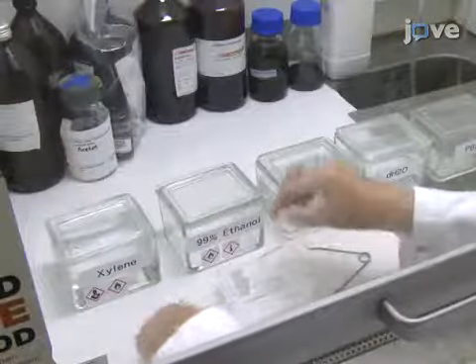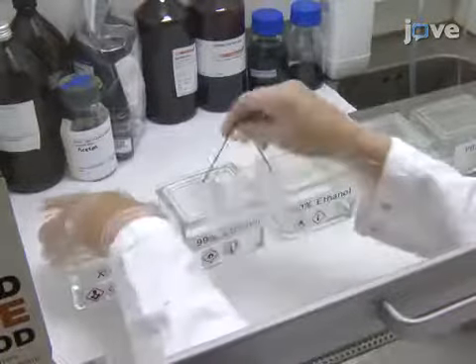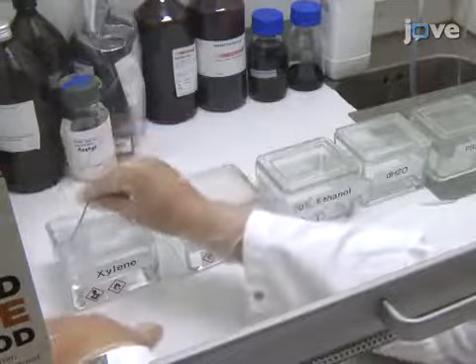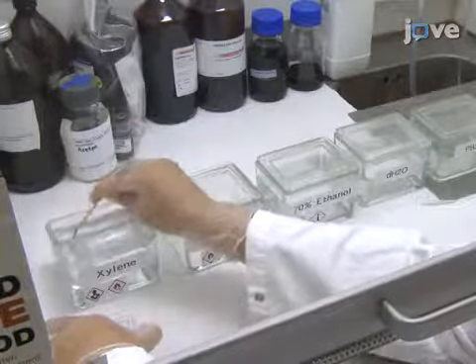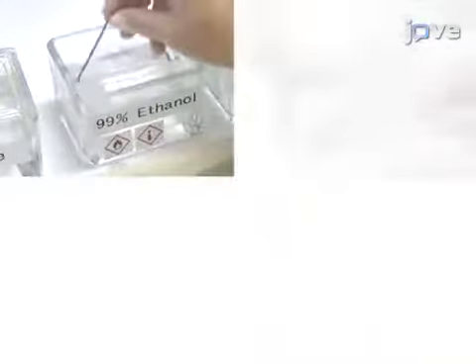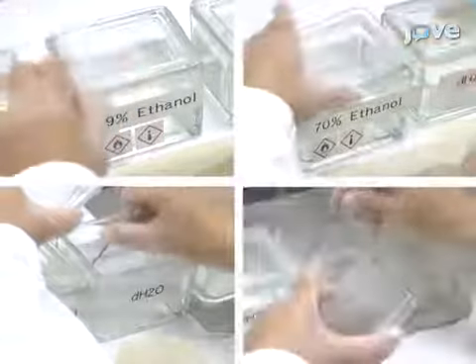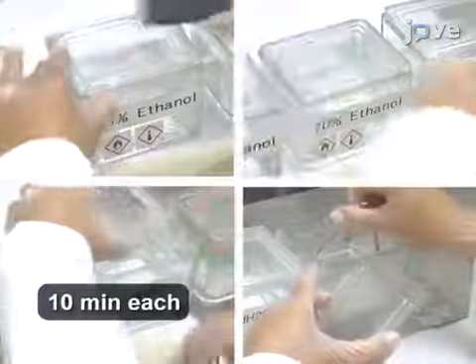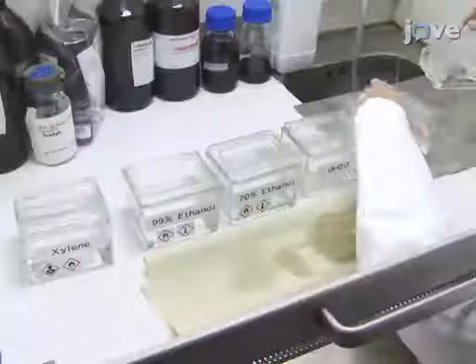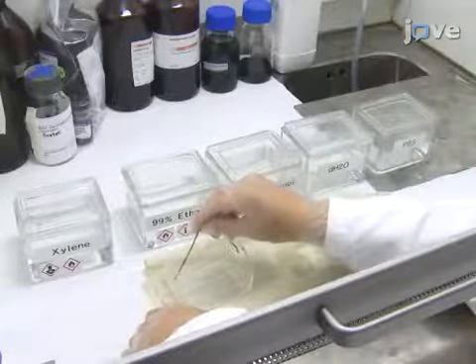If formalin-fixed paraffin-embedded sections are used, deparaffinize in xylene overnight. On the day of staining, immerse the sections in consecutive baths of 99% ethanol, 70% ethanol, DH2O, and PBS for 10 minutes each time. Then allow the tissue sections to dry under ambient conditions.